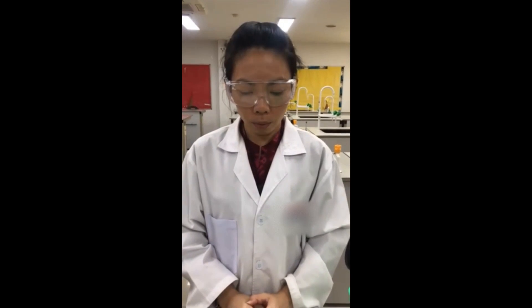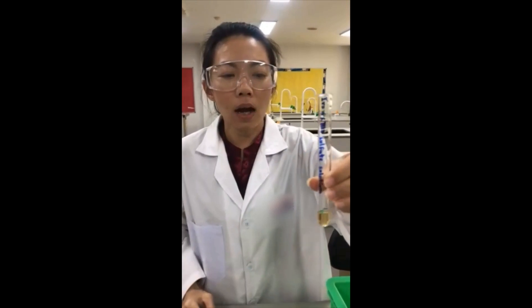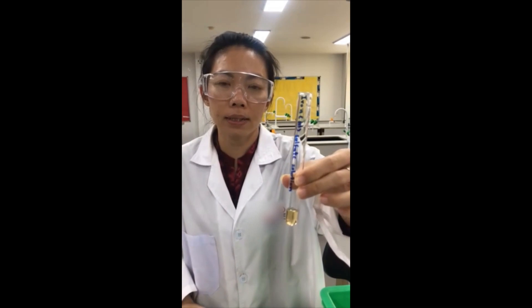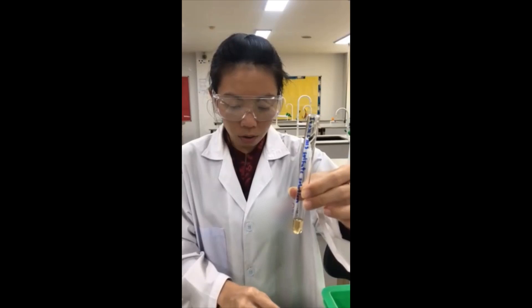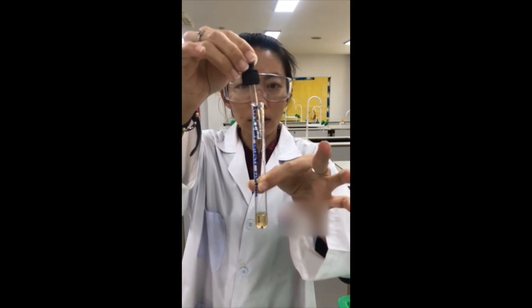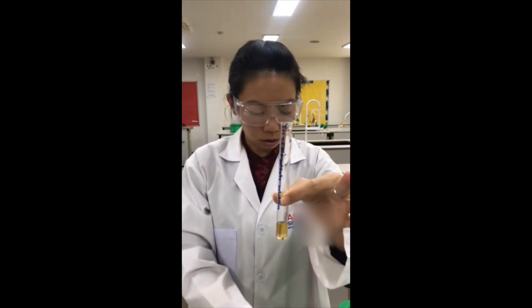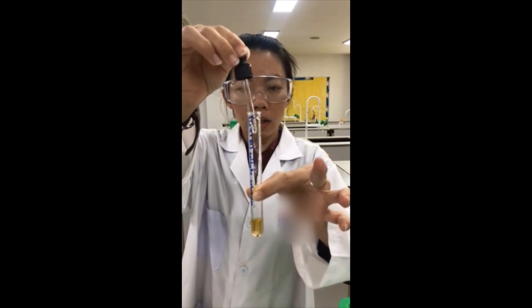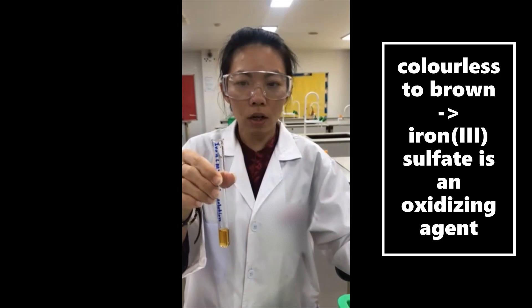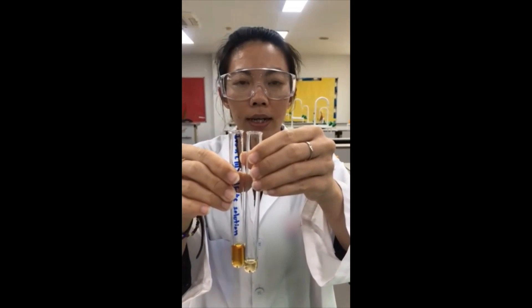In test four, we're going to test iron(III) sulfate. The color of iron(III) sulfate is very light brown because iron(III) is a brown color. We will add potassium iodide and see how the color changes. The more I add, the darker the brown color. If we compare this to the original iron(III) solution, you can clearly see the difference in the color.